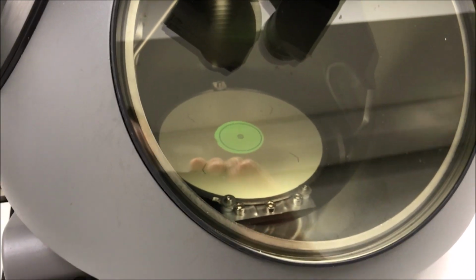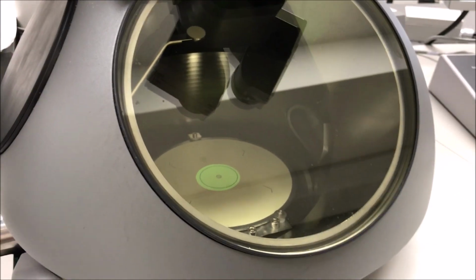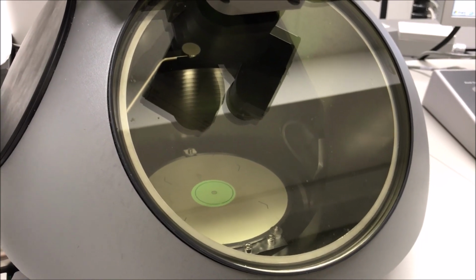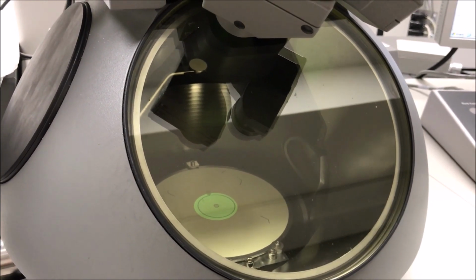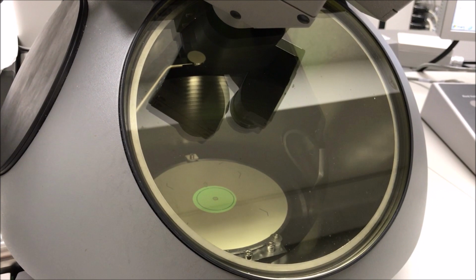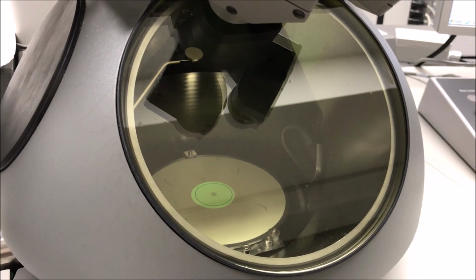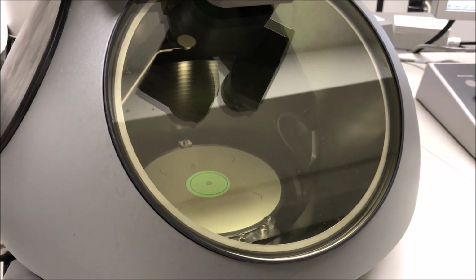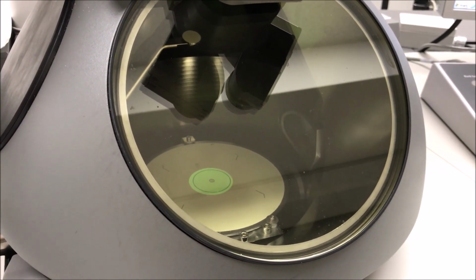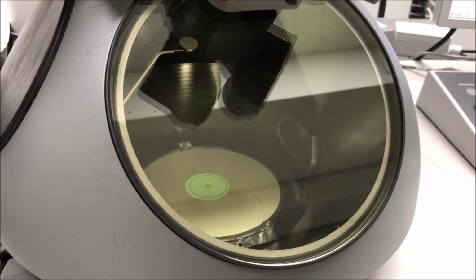Okay, right there. All right, so now what I have is a really high current reaching the sample, but it's spread out over a large area. So the aim of this, and this is called a beam shower, is basically not to remove contamination on the sample, but to take the contamination that's already on the sample and freeze it in place so that it can't accumulate in any one place.